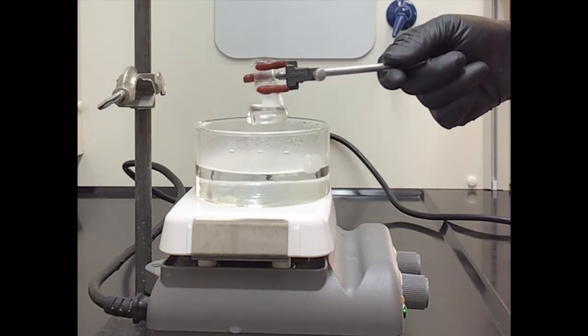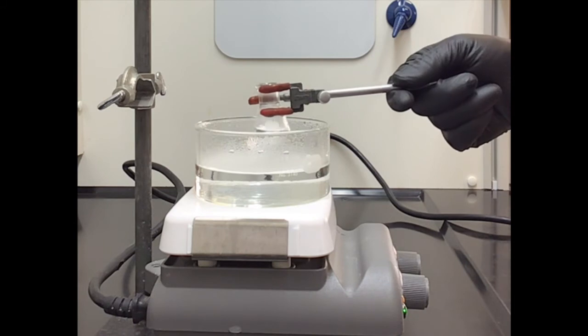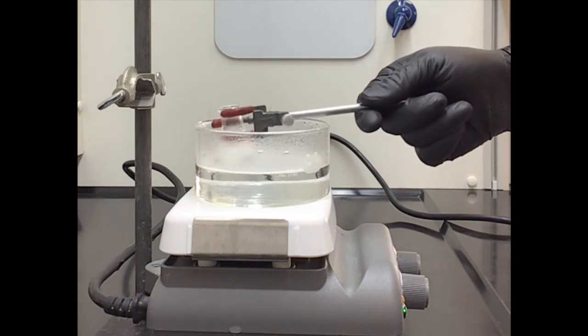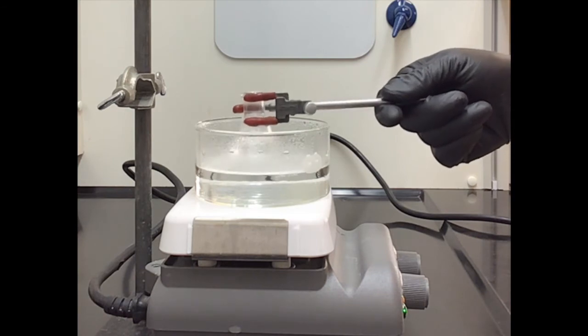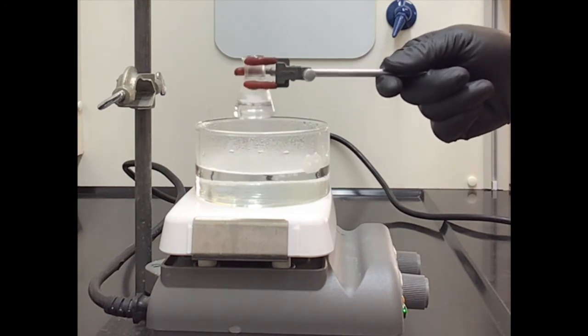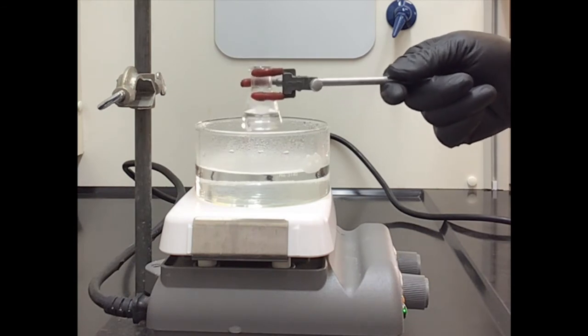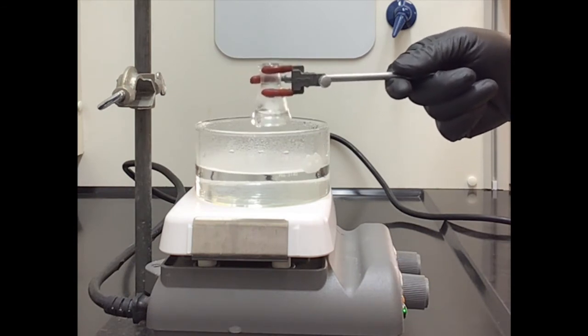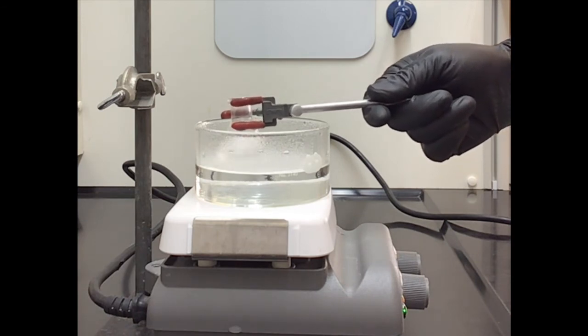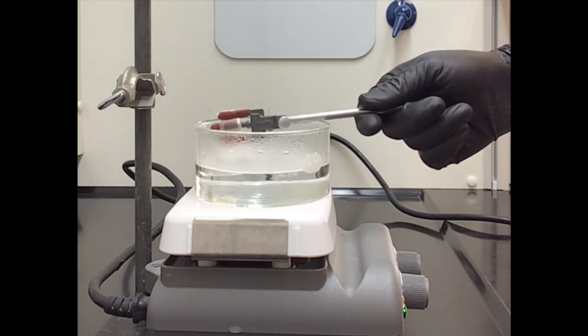We don't want it to bubble out of control because then it could bubble over and we'll lose some of our compound, our caffeine. But if you leave it in there unattended and walk away, it could get tipped over and you'll get water inside, and then that just ruins everything. This took forever, and you have to start over. If there's no time to start over, then you just take an L on that. You take a 0 maybe.